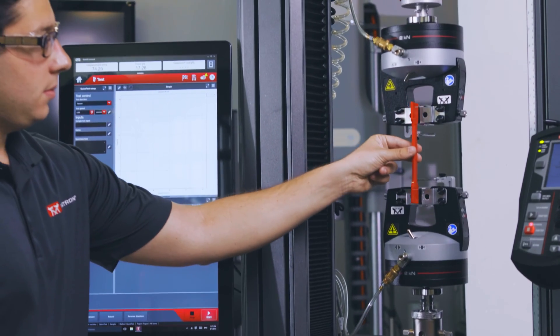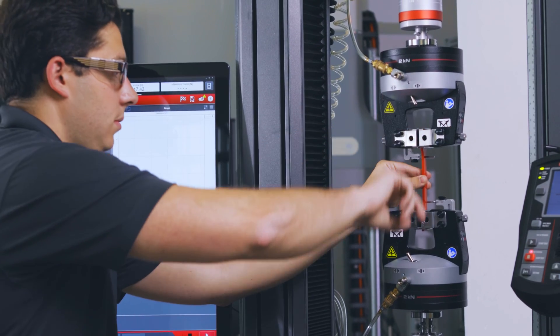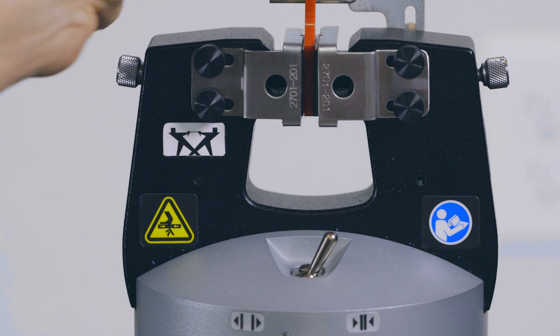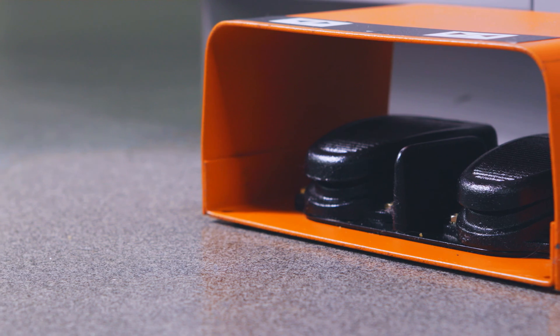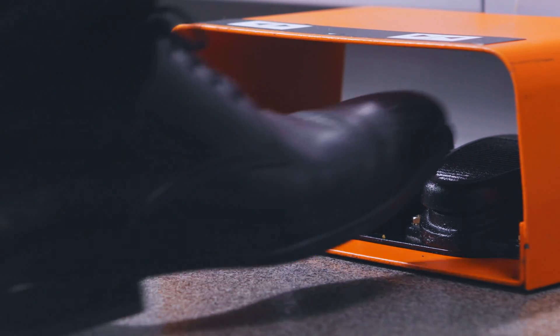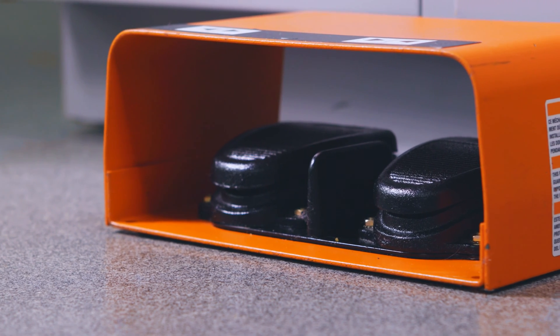The first is with a toggle switch mounted to the grips. Toggling the switch side to side opens and closes the grips, as shown by the label. Alternatively, a pneumatic foot switch can be used to actuate the grips. We recommend you use a single method to open and close the grips to mitigate risk.